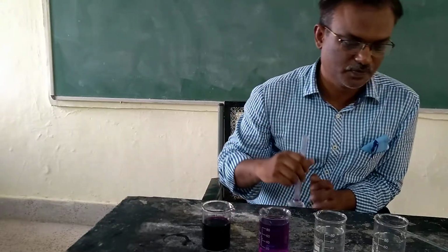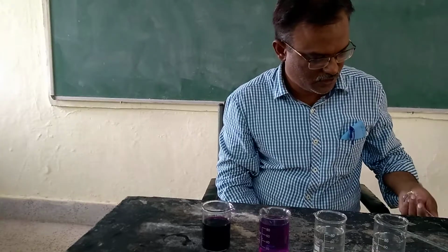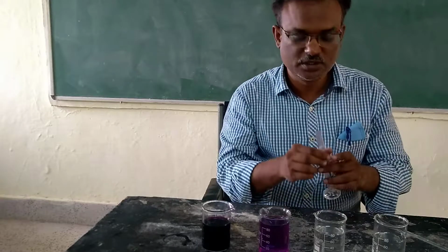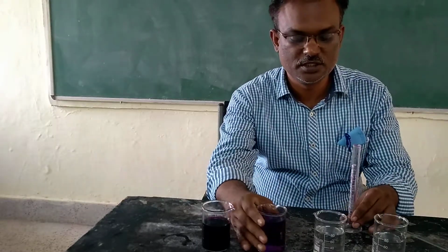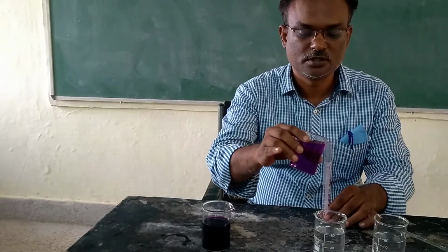Now I will take another measuring cylinder, and I will pour exactly 10 ml of the solution into it.